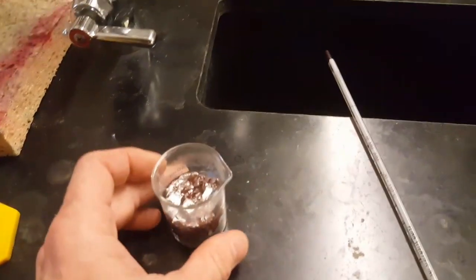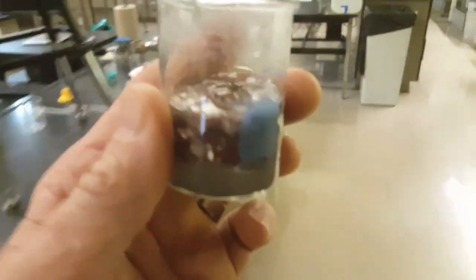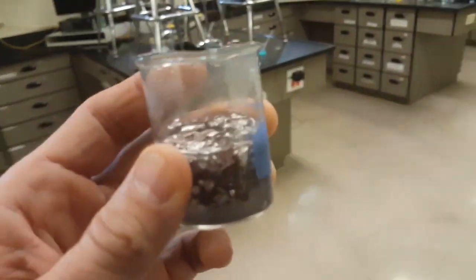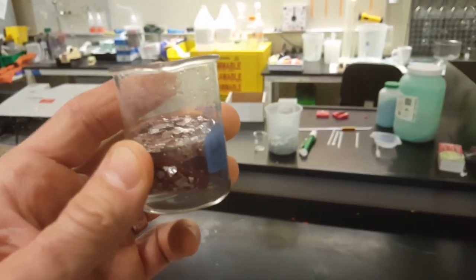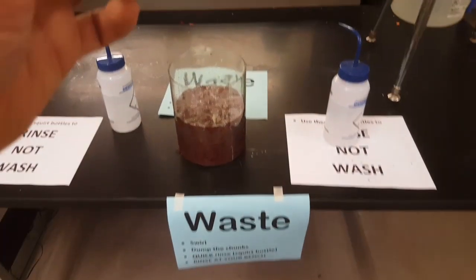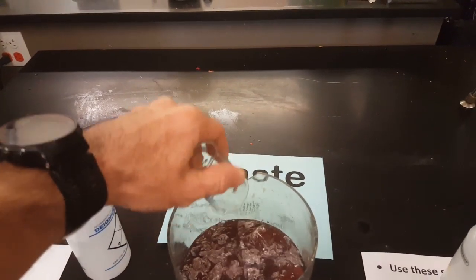Finally, what do you do with the waste? Well, you've got this beaker now with some stuff that can't go down the drain. And so we'll have to treat it and make sure that it doesn't affect our fisheries. And so here in the middle of the lab, we've got a waste bucket or a waste jar. And just pour it in there.